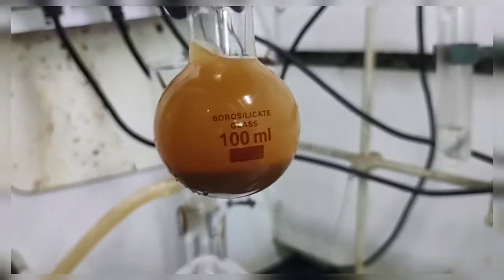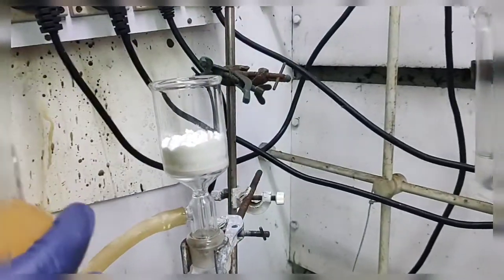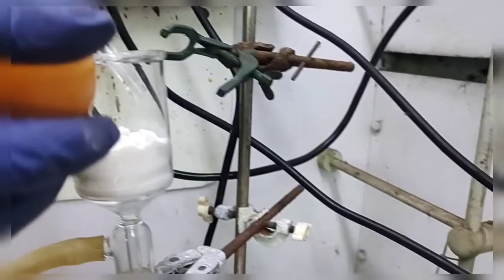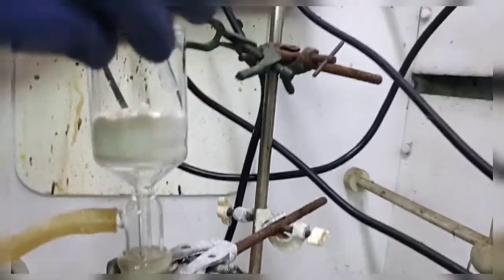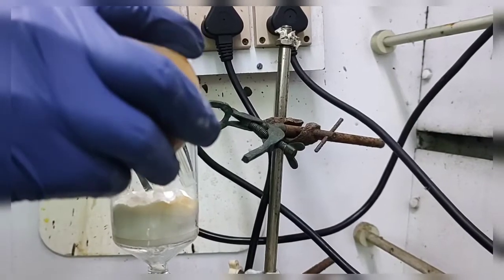This is the reaction mixture which we are going to filter today. We will put this reaction mixture into the sintered funnel using the glass rod.